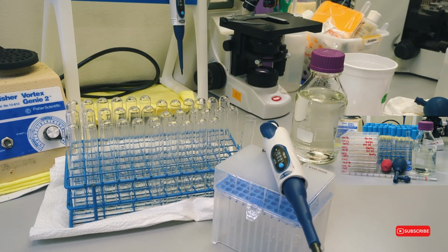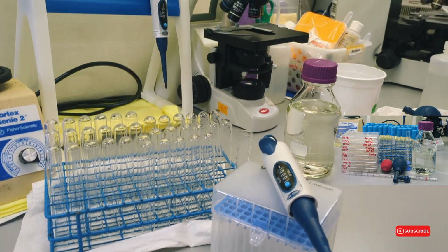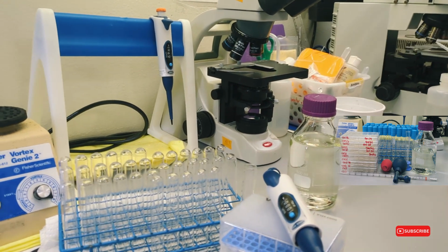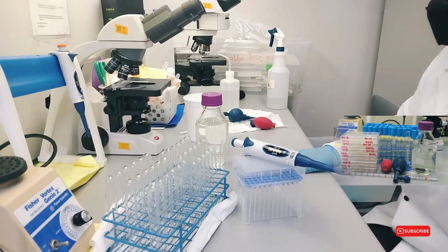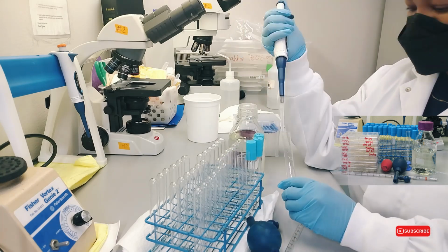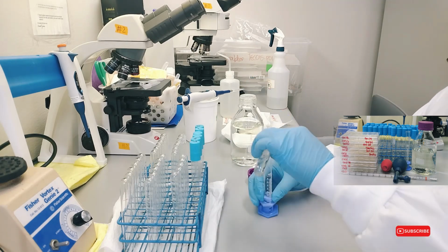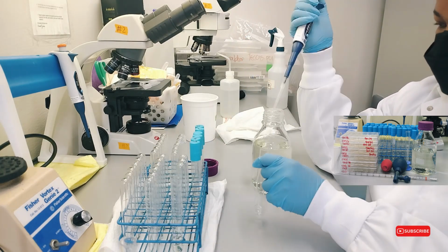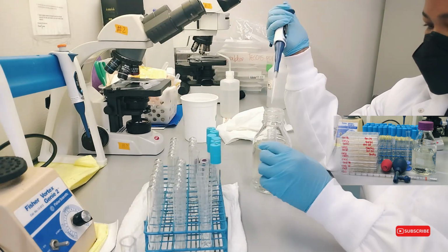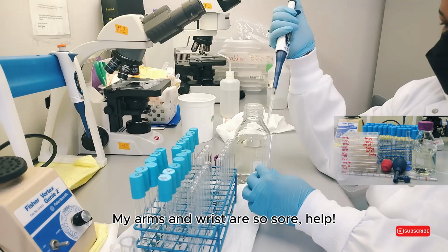Well, it didn't work, so I will have to manually put 4 ml, using 1 ml each time, into all these tubes. Jesus. My arms and wrist are so sore. Help.